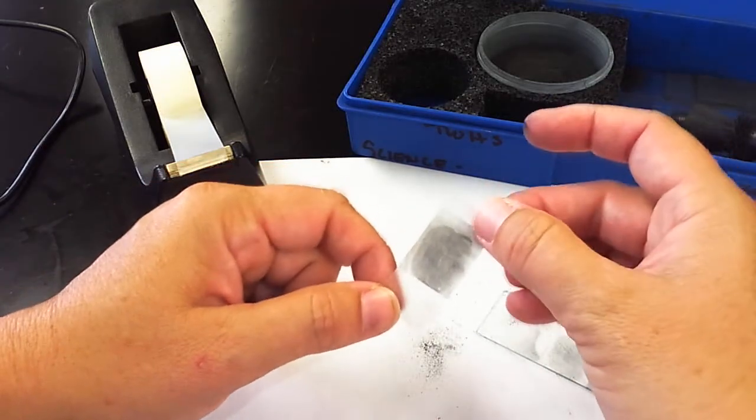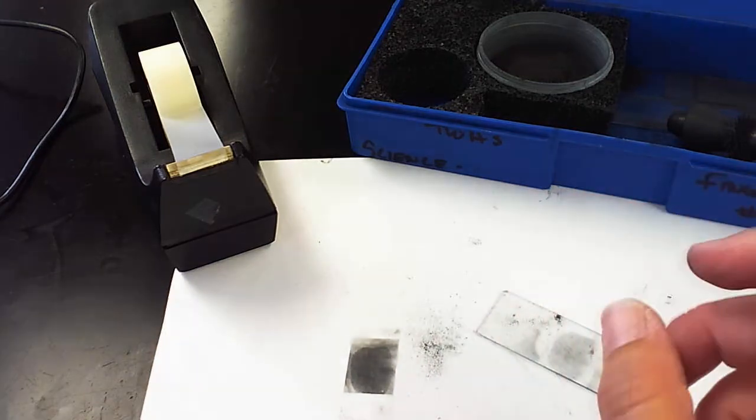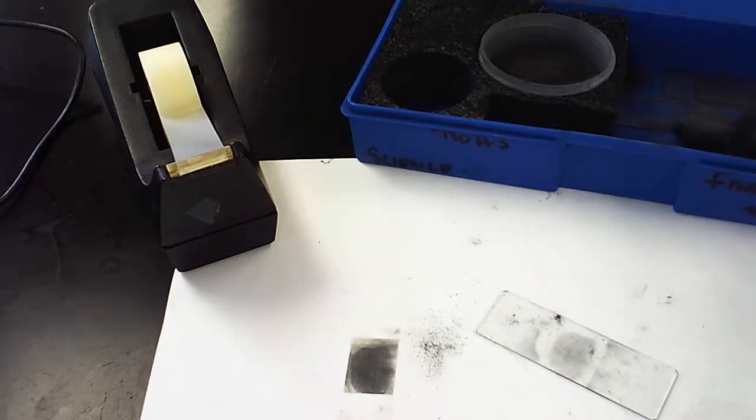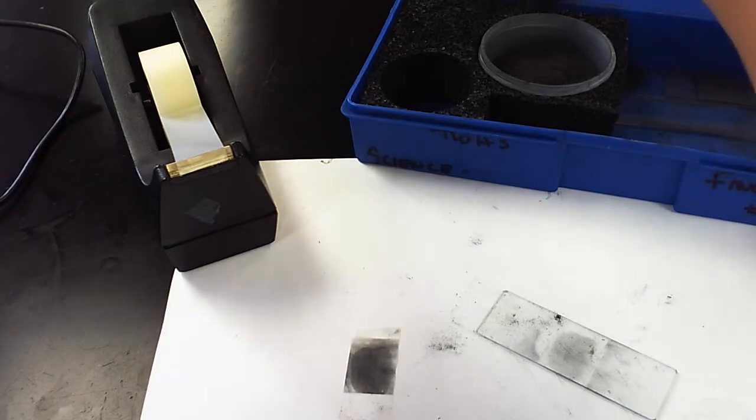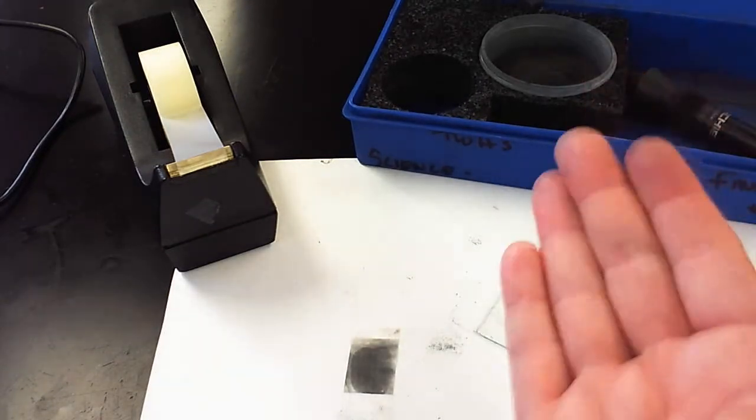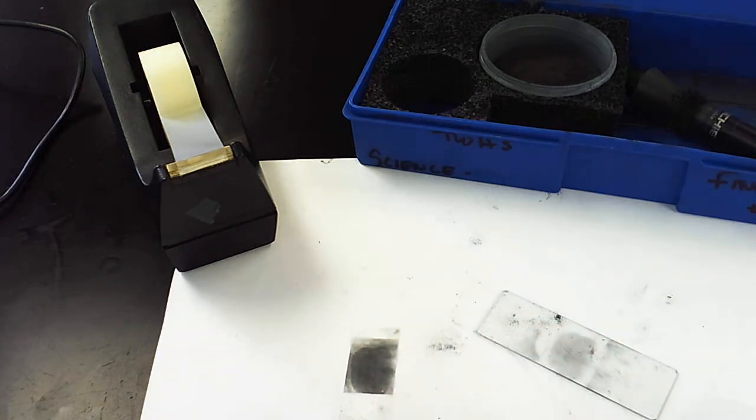This is a very messy lab station. I can't say that enough. So I do ask that you clean up when you're done. Try to use your wand to go pick up some loose particles and put them back in the jars. And then also wash your hands when you're done. And if you could wash the lab table a little bit with some paper towels or some wipes, that would be helpful. Thank you so much.